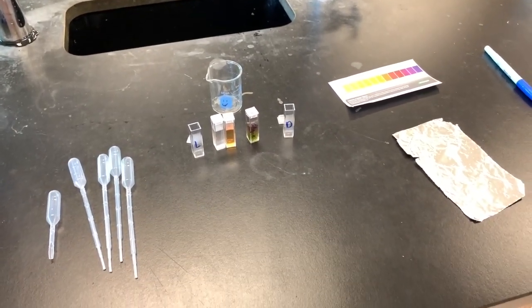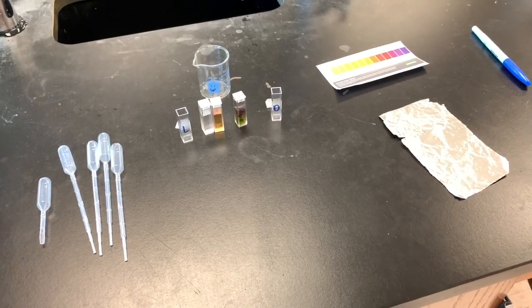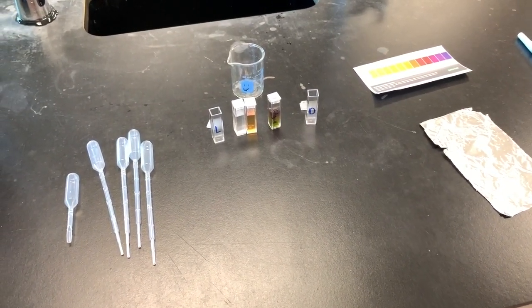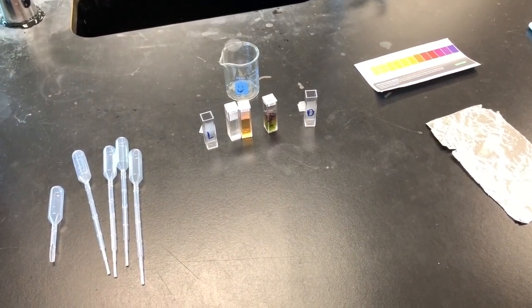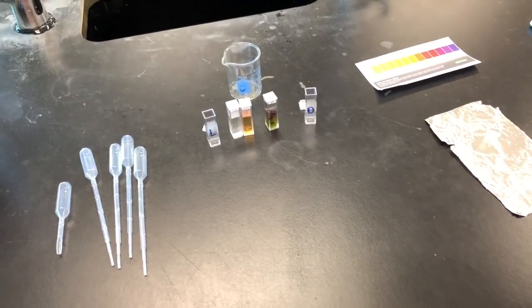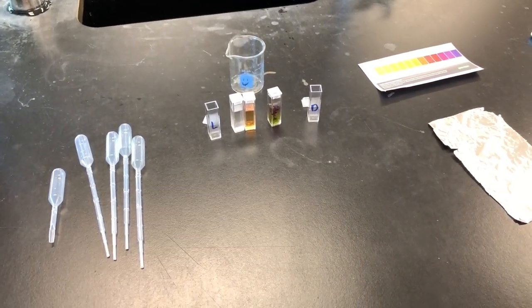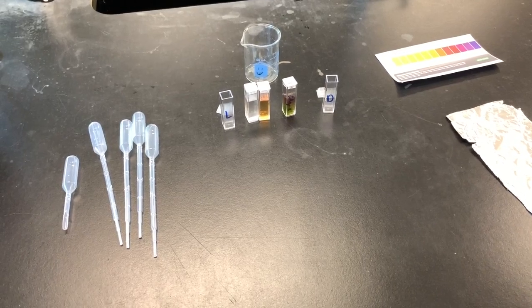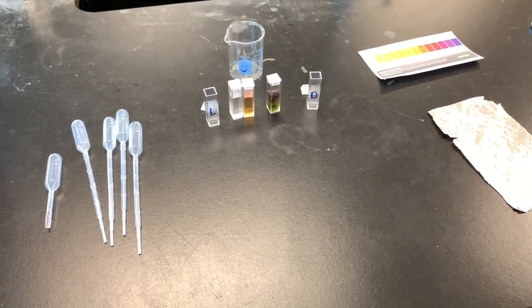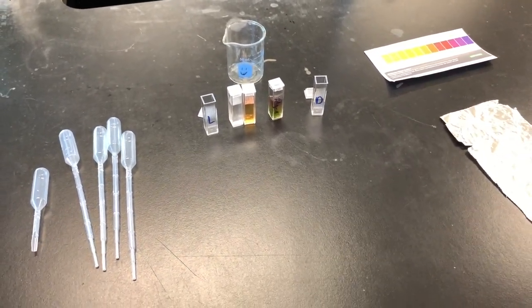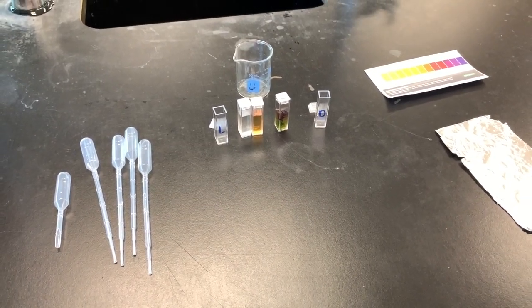Welcome to the photosynthesis and respiration lab. We're going to be measuring how algae beads photosynthesize as well as respirate and how we can measure each one individually and what that does to the pH of water.